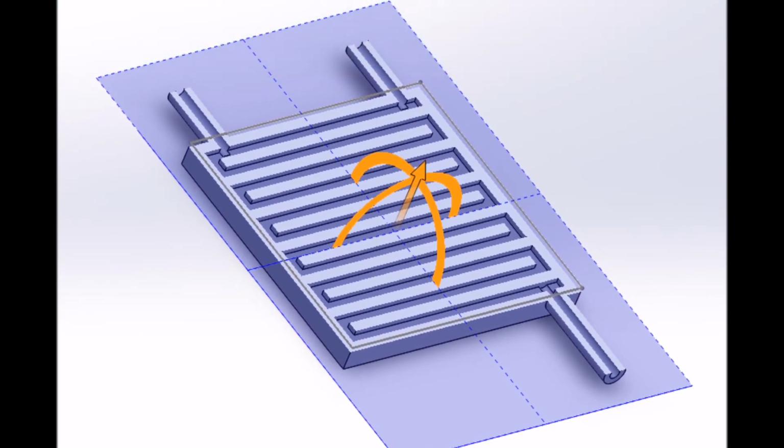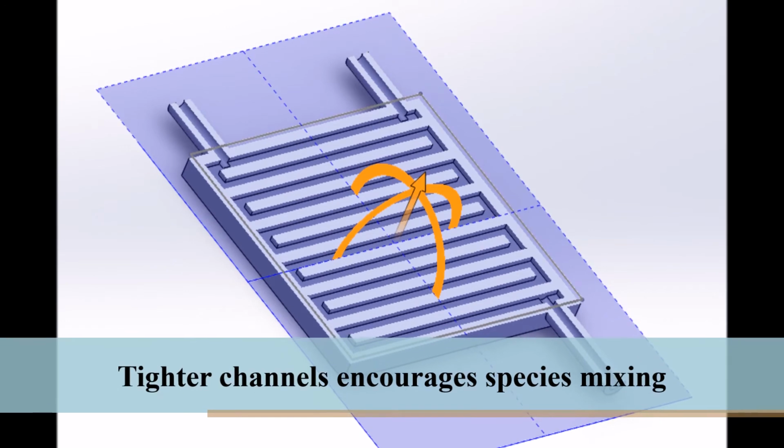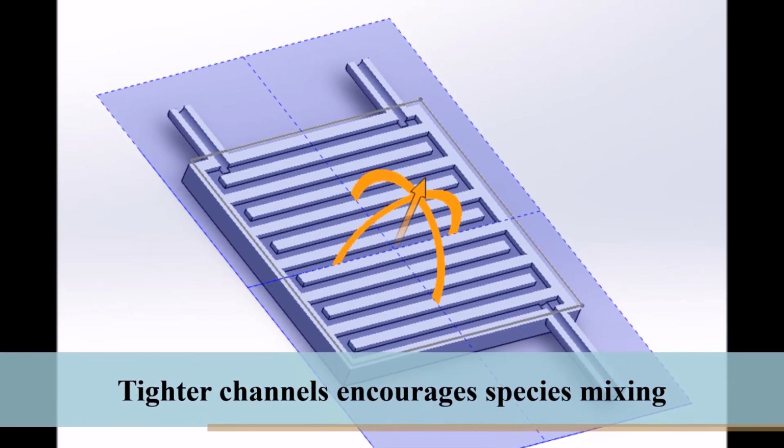We also made the reactor channel narrower for the serpentine. The narrow channel will promote mixing by confining the reagents to a tighter space.